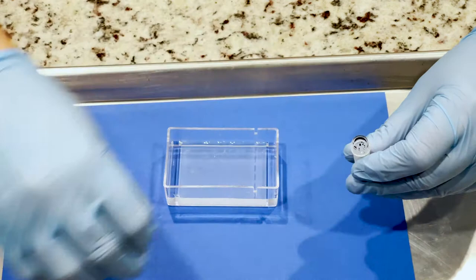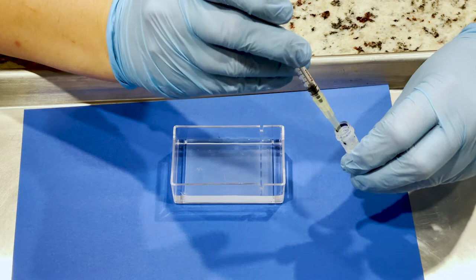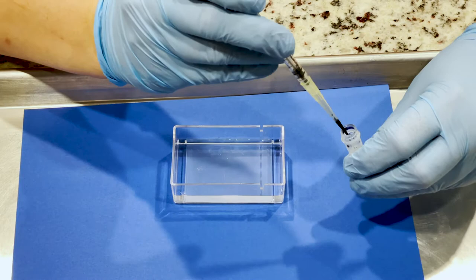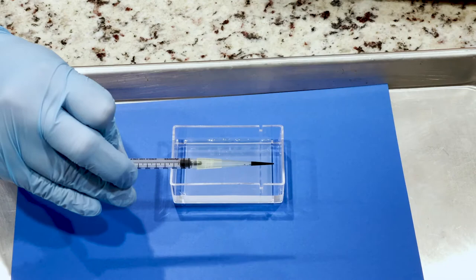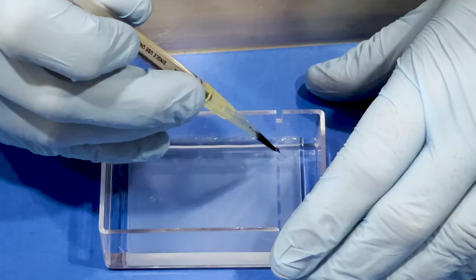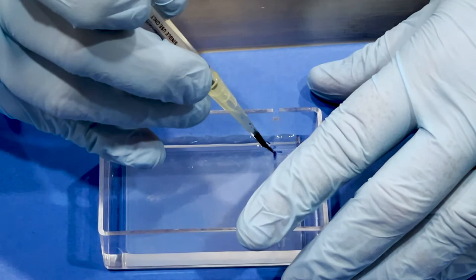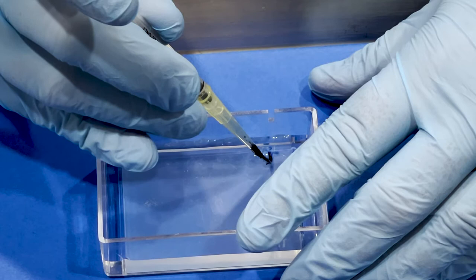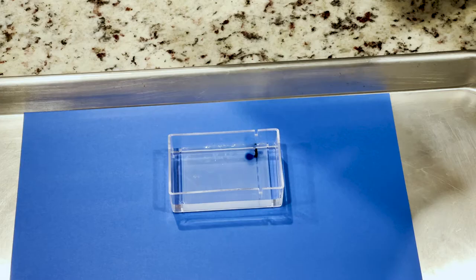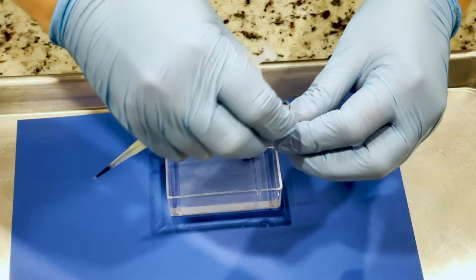Now this part can be tricky. You're going to use the pipette to pull up some of the dye and deposit that dye in the well. You'll notice the amount of dye that I have in my tip—I actually discovered that's a little bit too much. As you see, when I put it into the well it's going to overflow, and that's what you want to avoid. I recommend pulling up less of the dye than what I did because you want to fill the well but not overflow it like I did with that first sample.